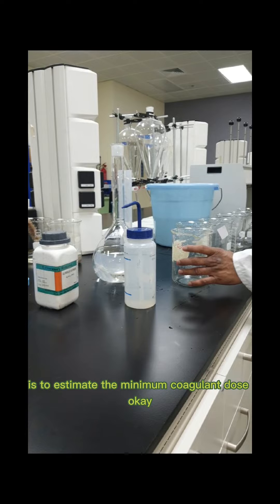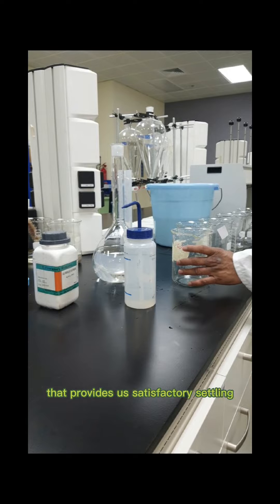The purpose of this test is to estimate the minimum coagulant dose required to achieve certain water quality goals. In other words, the jar test helps determine the right amount of treatment chemicals, the lowest dose that provides satisfactory settling in the water treatment.